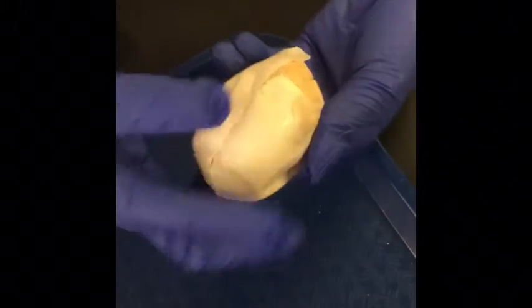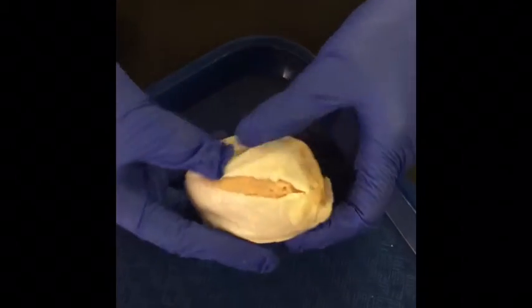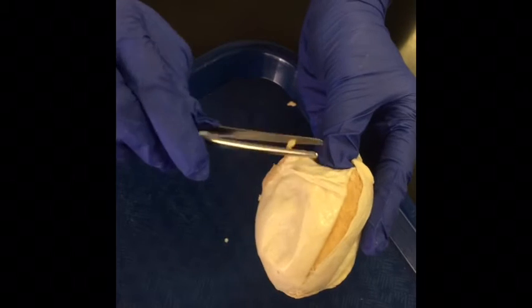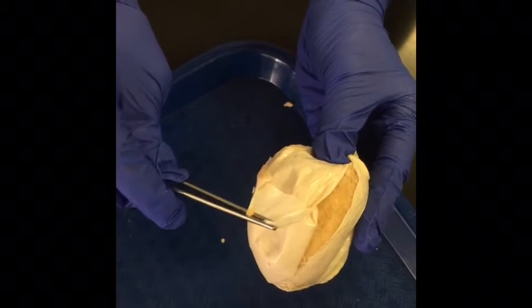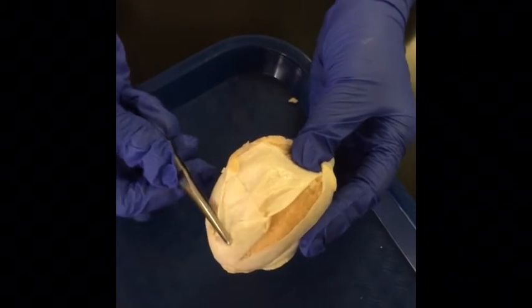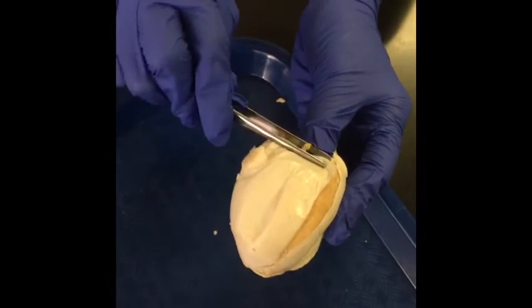There is connective tissue that covers the outside of the epididymis, and it's called the tunica vaginalis. This part right here is the first layer — it is the parietal layer, and it lines with the scrotum, which essentially makes it part of the scrotum.